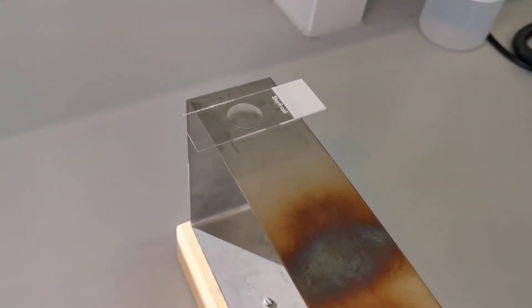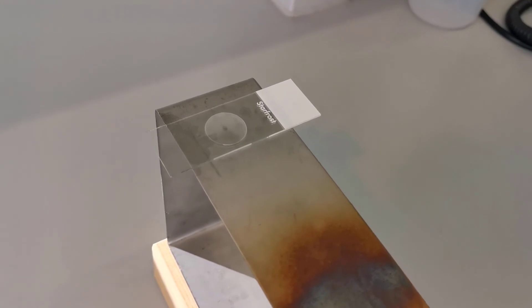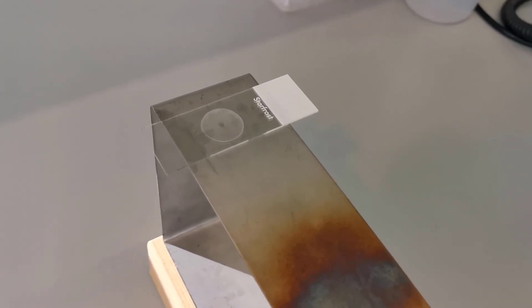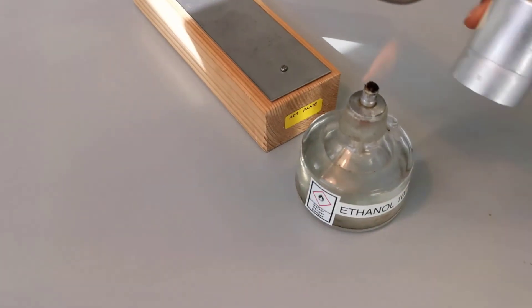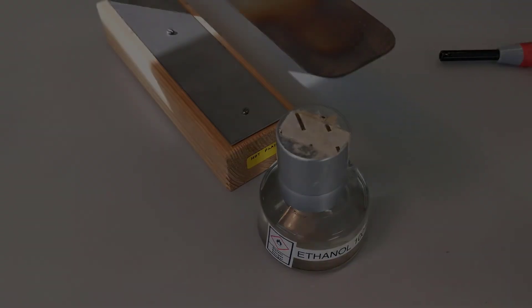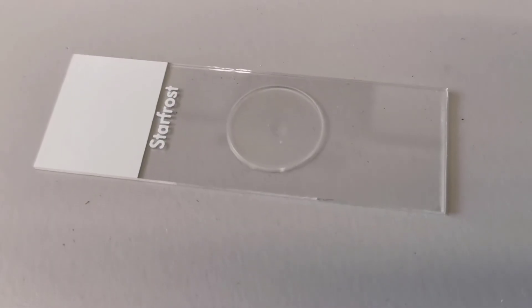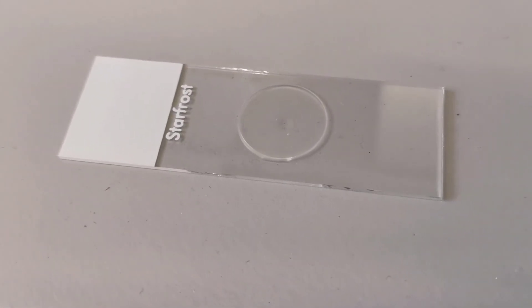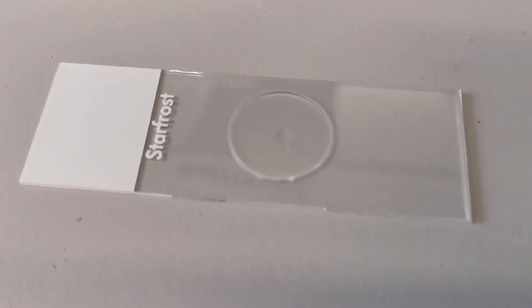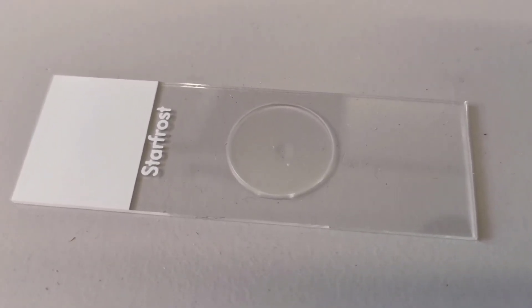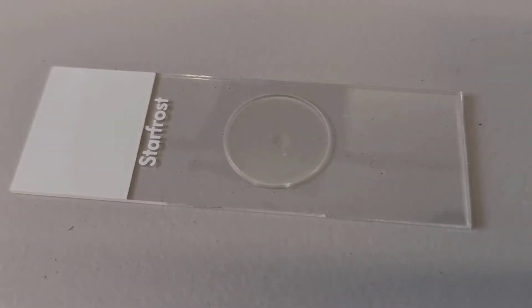Now finally cool down your slide, during which the wax will solidify. The wax holds the cover slip and protects the glycerin drop containing your mounted fixed nematode specimen. The slide should be leveled well, studied further and can be stored for years.